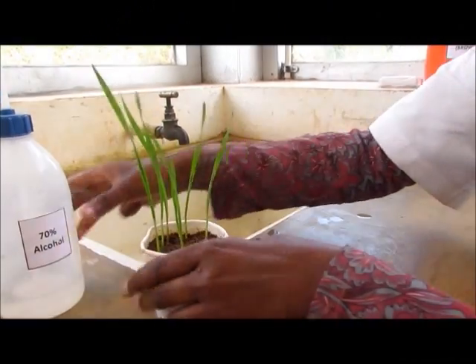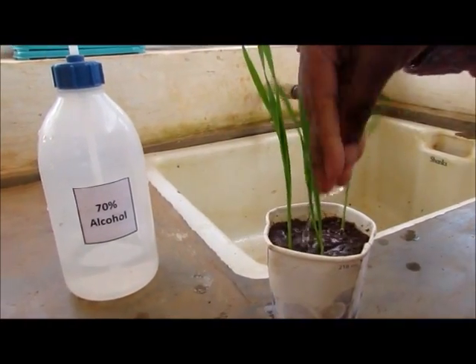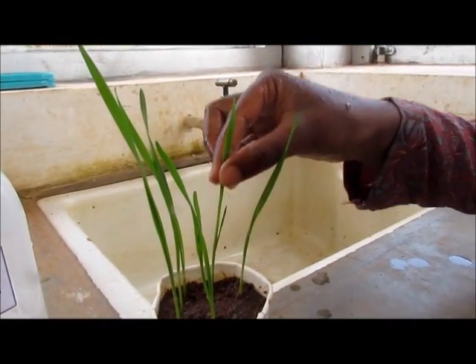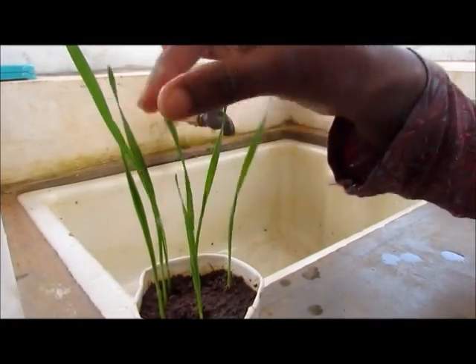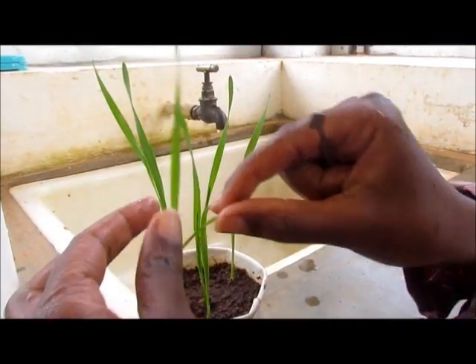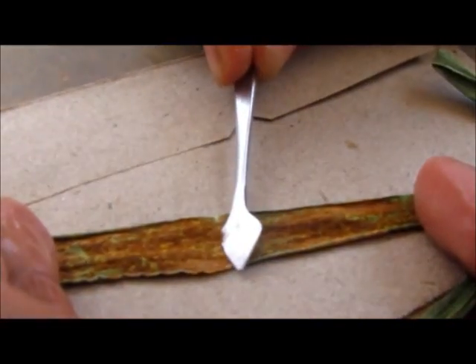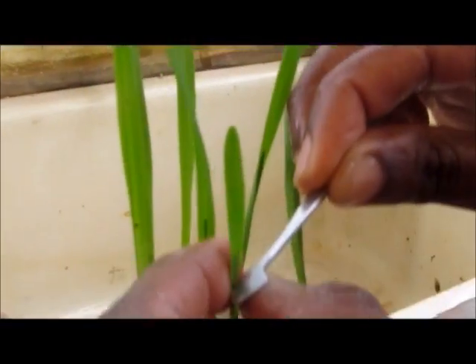For inoculation of the rust pathogen, 10-day-old seedlings are selected. Before inoculation, hands are washed with 70% ethanol and water is sprinkled on the seedlings to maintain the moisture necessary for the development of rust infections. If the second leaves of the seedlings are large, remove them by pinching. Then scrape the rust spores with a lancet needle and apply uniformly on all the leaves of the seedlings.